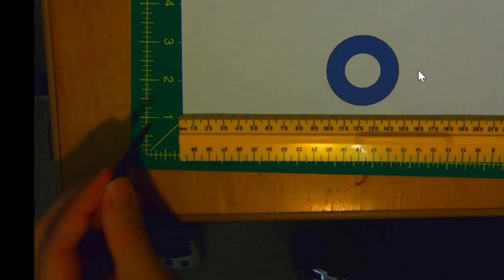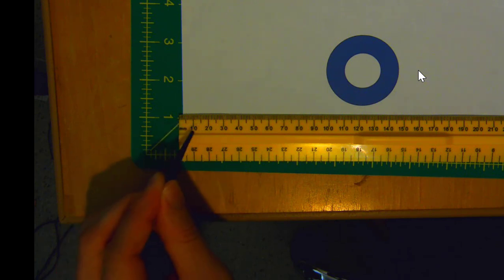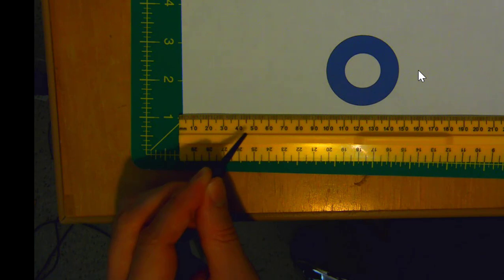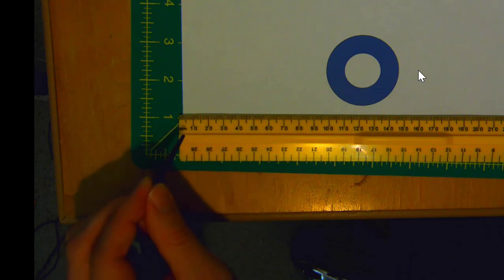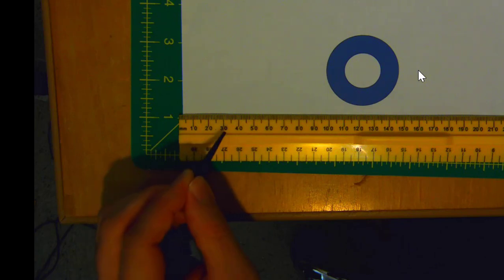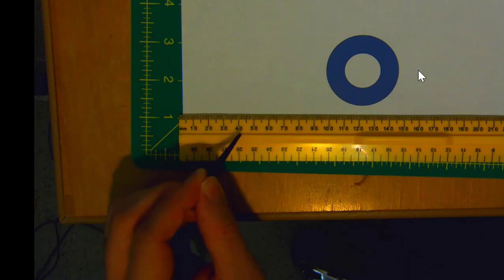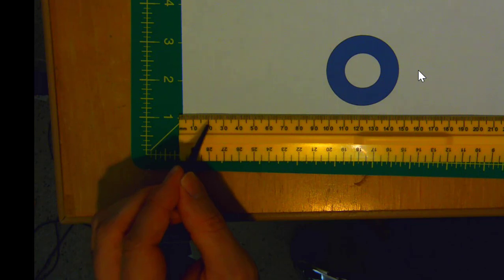So you'll notice that we're indicating units of millimeters. Millimeters would be 10, 20, 30, 40, 50. When we do this measurement today, I would like you to use units of centimeters. We will still be using this same scale, but what you'll do instead is you'll have centimeters, you'll have 1.0, 2.0, 3.0, 4.0, etc. And then the little marks in between would be tenths of a centimeter. So 1.1 up to this longer one is 1.5, and then all the way up to 2.0.